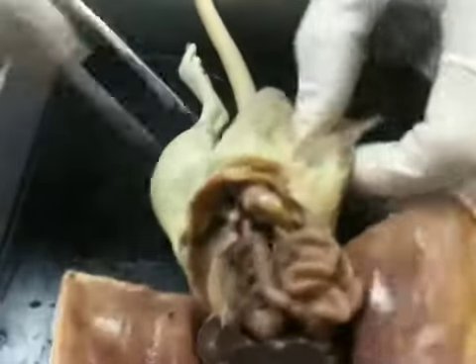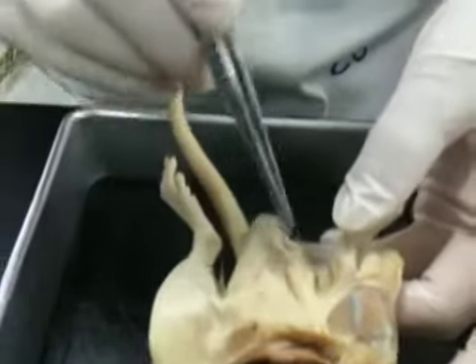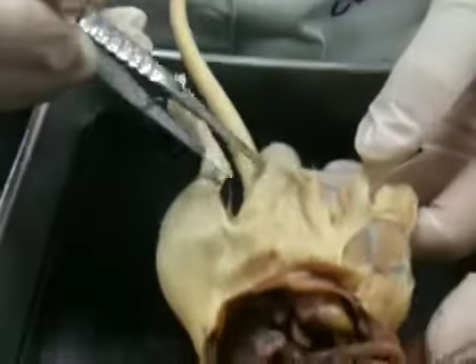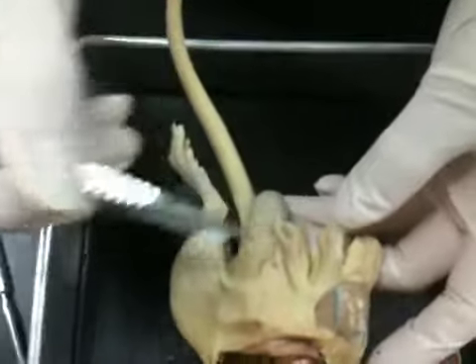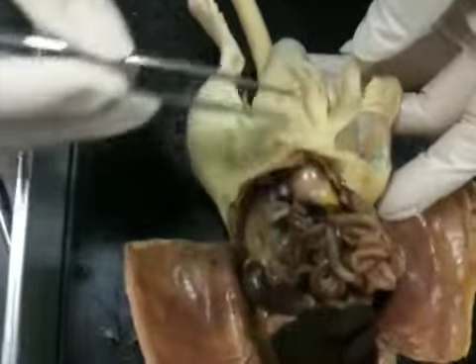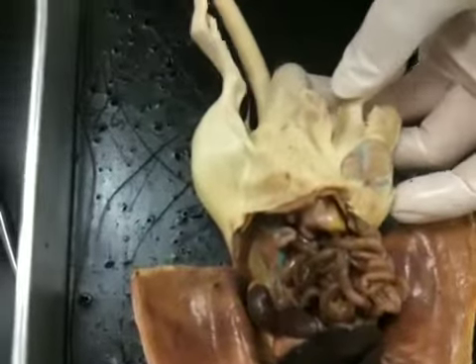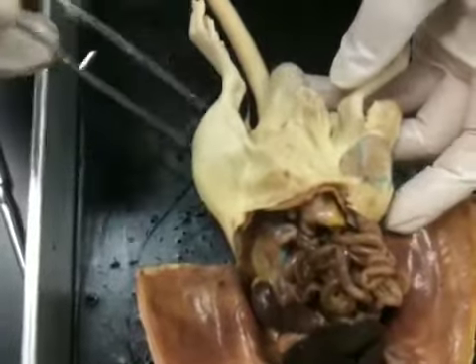Now, this particular male rat has an undescended testicle. So you can see this. You can see the scrotum right here. Here's one testes, but the other testes is actually all the way up here. So when we open this up, we'll be able to see that, and we'll be able to push that down a little bit. Happens quite frequently, much more frequently than people realize, even in humans.